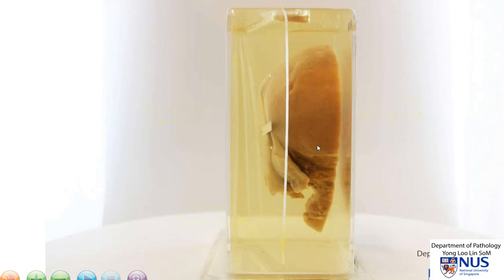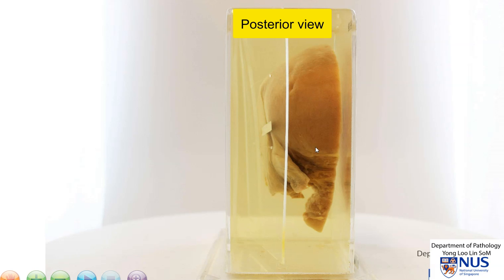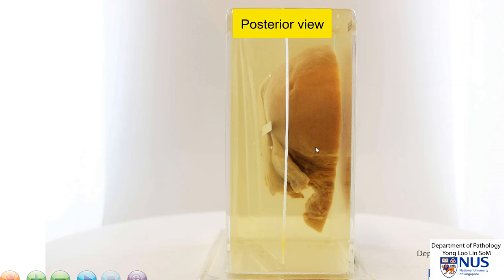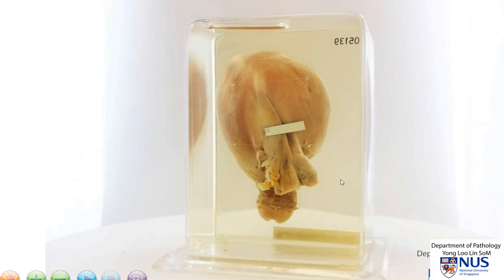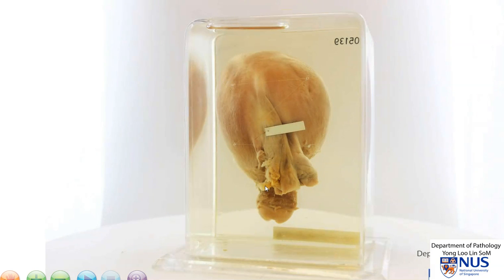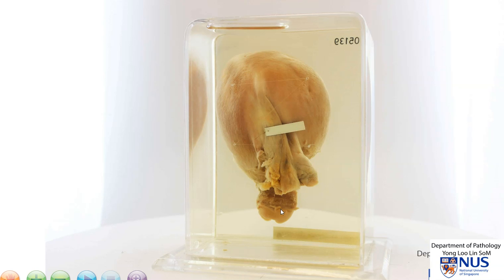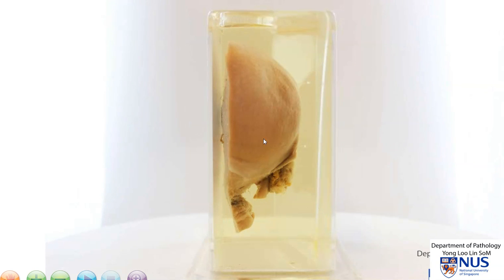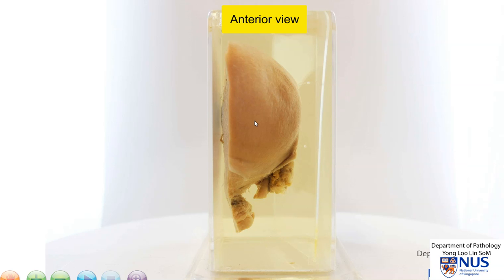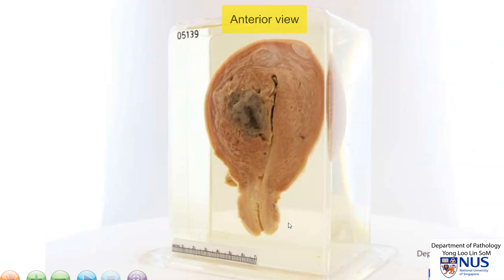Here is the posterior surface, and this is the posterior uterine serosa. This is the left-sided adnexal structures. This is the anterior uterine serosal surface and the cervix.